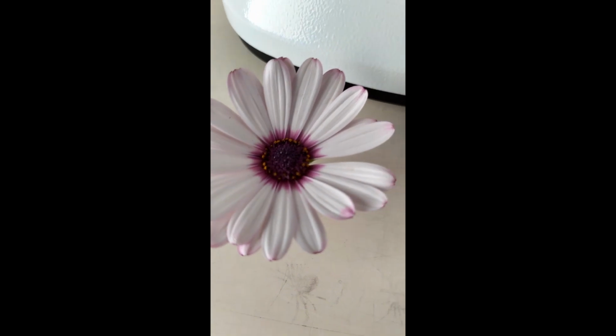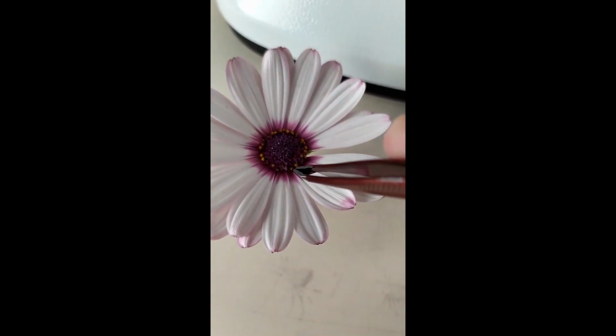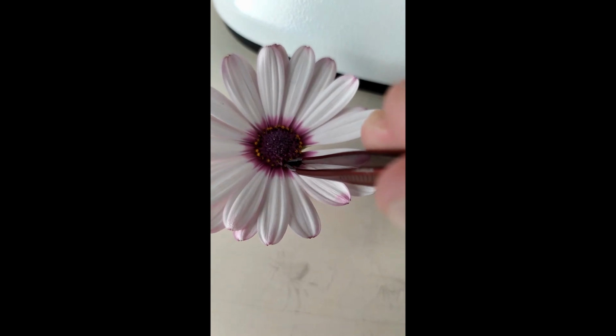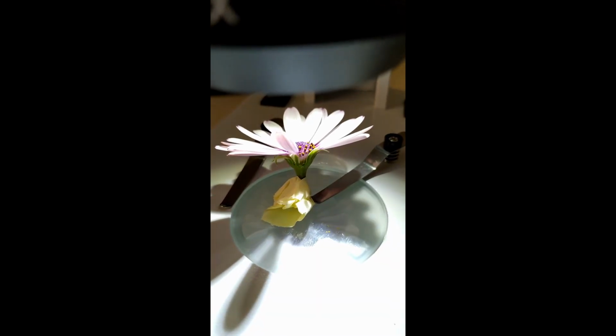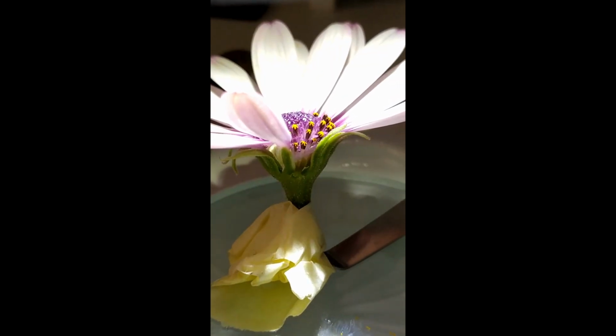Now we're gonna move on to the disc flowers, which was a pain to take out. But what I did here is take a bunch of the bracts and phyllaries, ray flowers out. Then I was able to cut through some of those male flowers. And as you can see, there's no ovary underneath, it's just connecting. So I put this perfectly like that, so you see that there's no ovary underneath it.